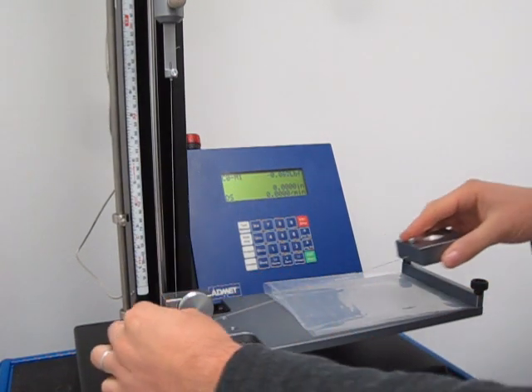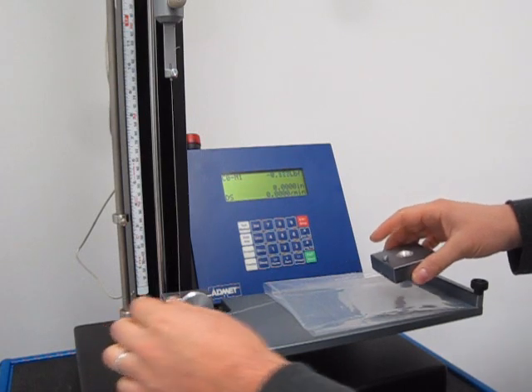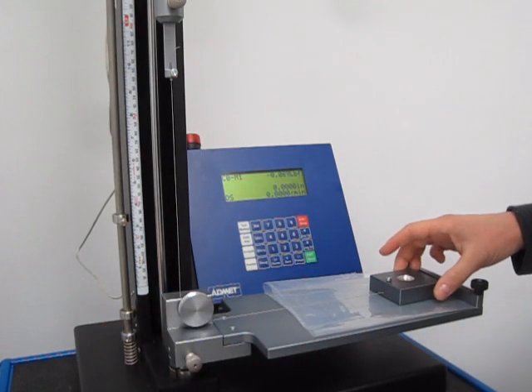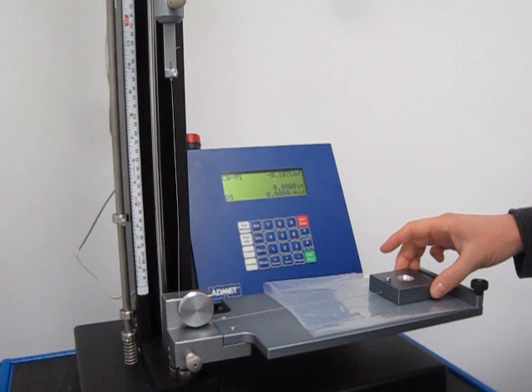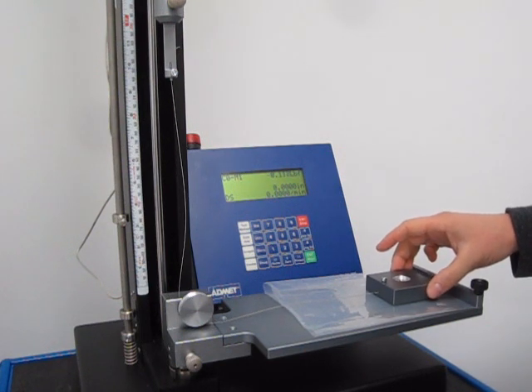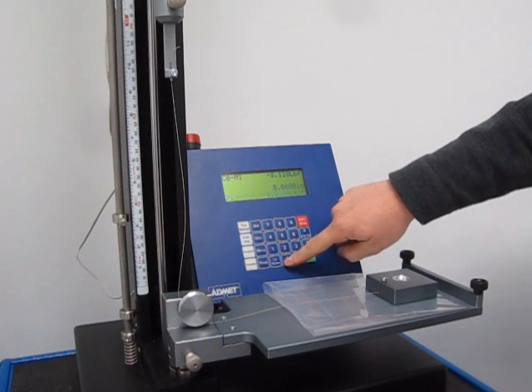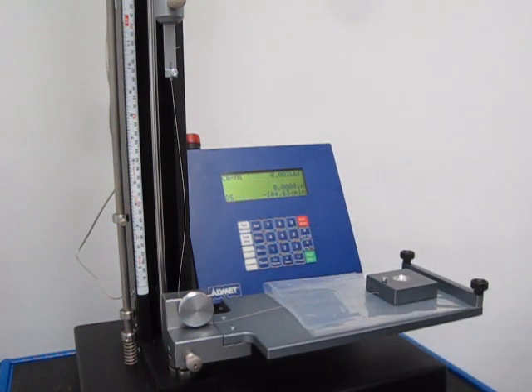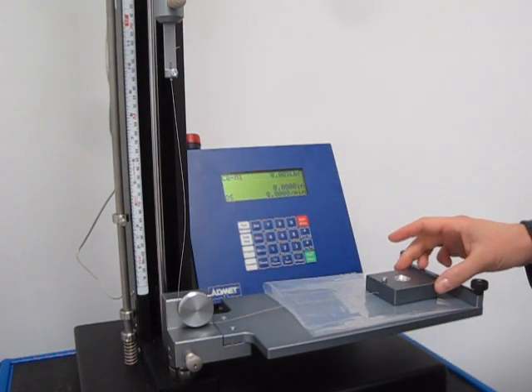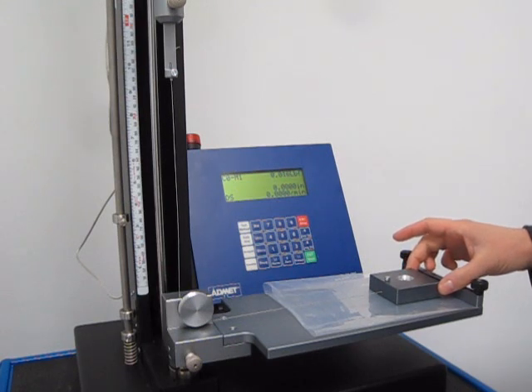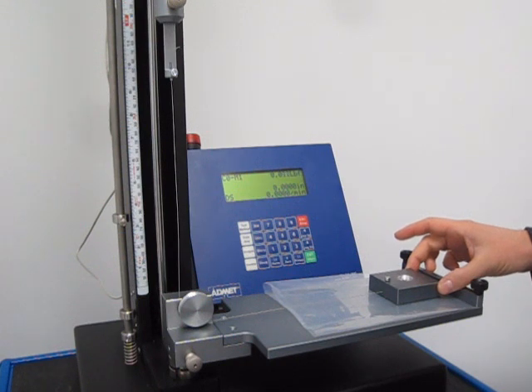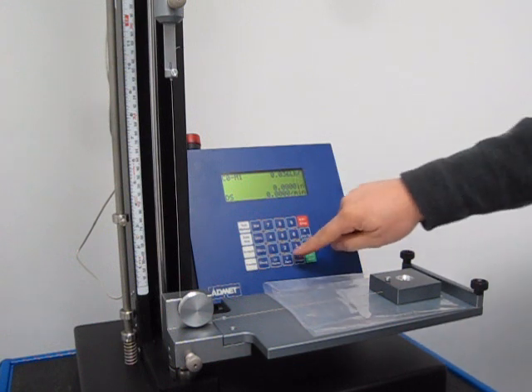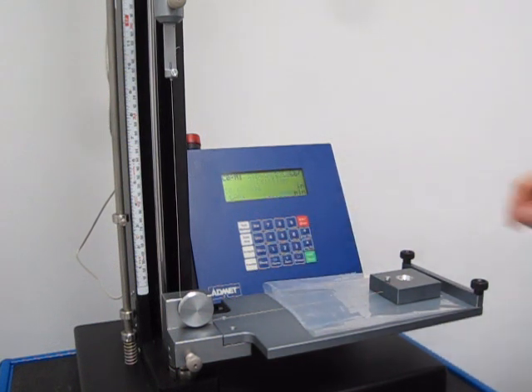We'll take the sled and slip it over the pulley, pull this to the end and move it so there's no slack. Zero out both load and position, then pull this back until it's tight, but push it forward so you don't have any load on the sample. You'll always have a little bit, so at that point just zero that out.